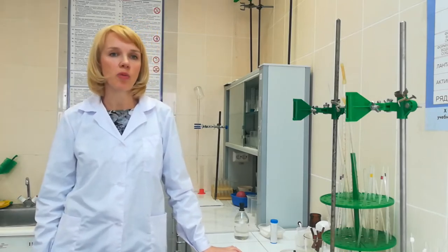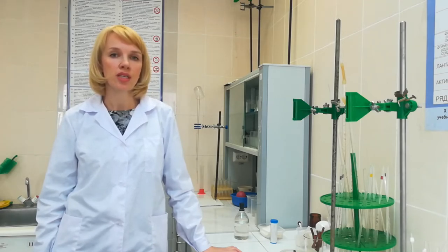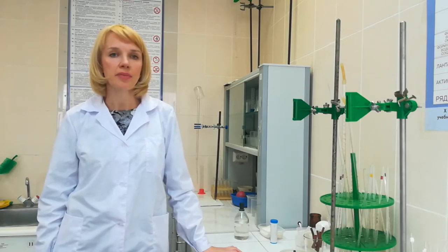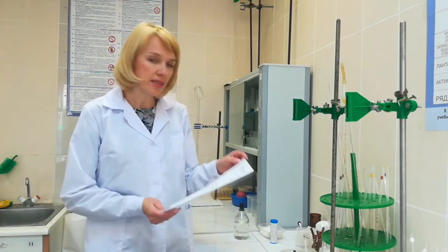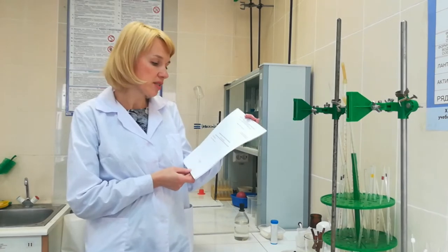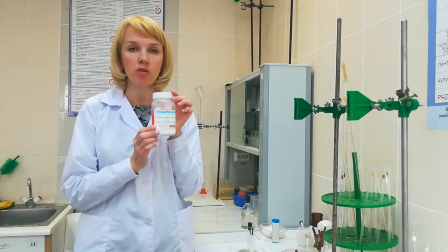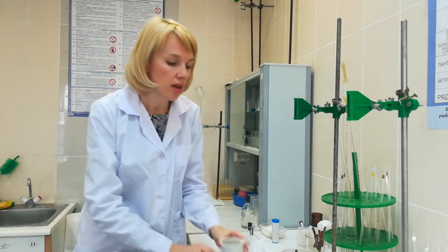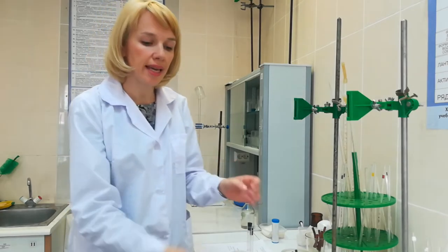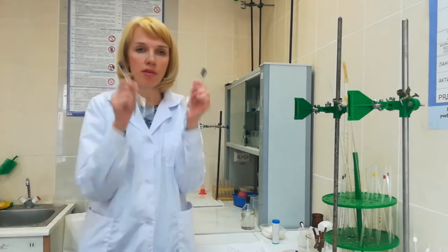Today we will do laboratory work number one. The topic is preparation of a solution of certain concentration and determination of its concentration by conductivity. We will prepare a solution of sodium chloride using dry sodium chloride and distilled water. To weigh the sodium chloride we will use scales, and to prepare solutions we will use flasks.